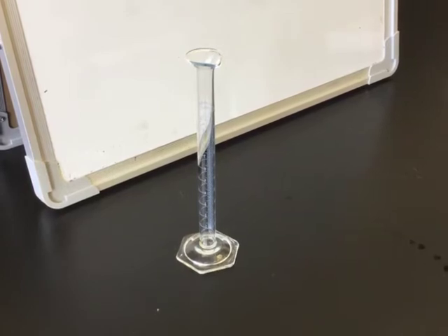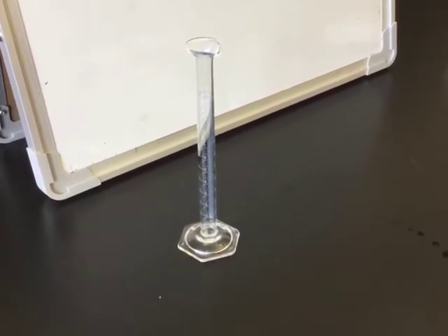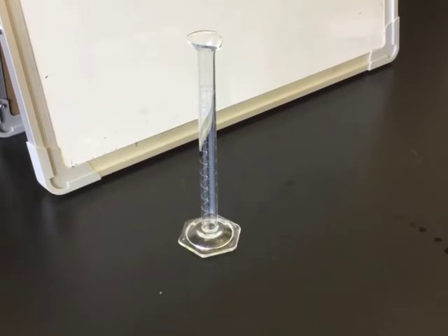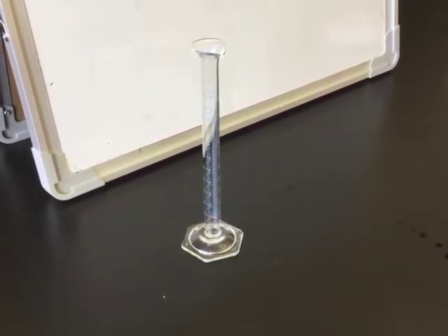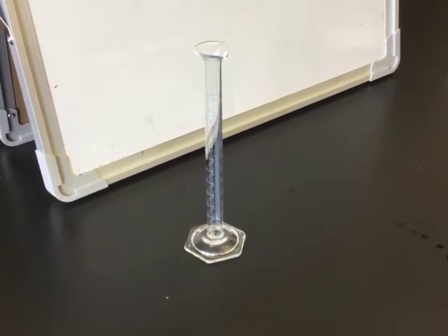When you are done, be sure to empty your graduated cylinder and shake out the excess liquid so that it can begin to dry before the next class needs to make their measurements and the next student will have a clean and dry graduated cylinder.